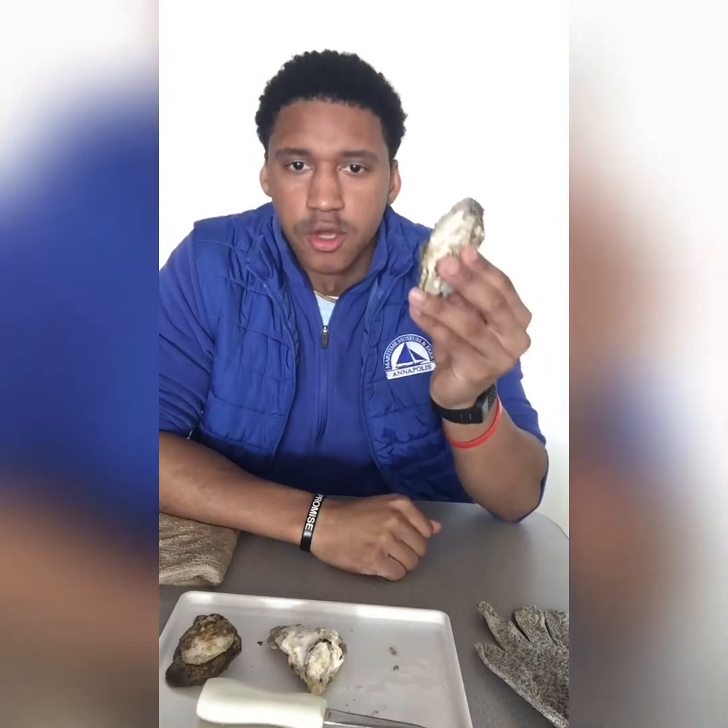And of course you'll need your oyster — very important. So we have all the things we need. Now before I actually dissect the oyster, I'd like to say a few fun facts. Oysters are referred to as bivalves. The word bivalves means two — it's like bicycle, two tires. So bivalves just means two shells. You have a top shell and a bottom shell — it's a bivalve.